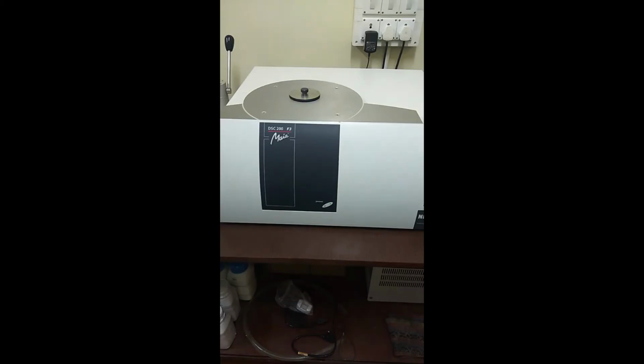Hello everyone, this is the demonstration video of DSC. The instrument placed right in front is the DSC instrument from NETZSCH.